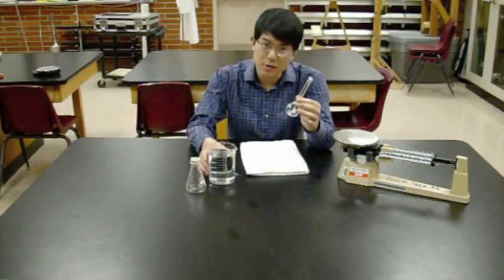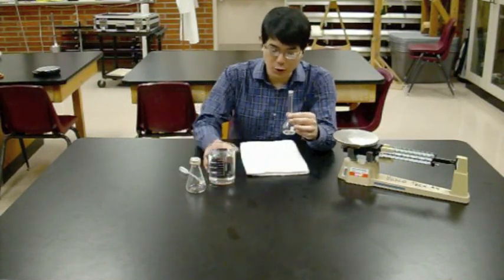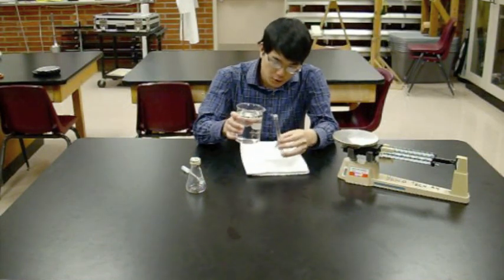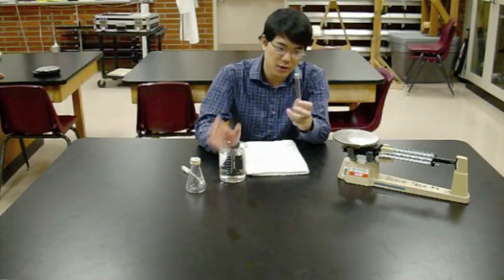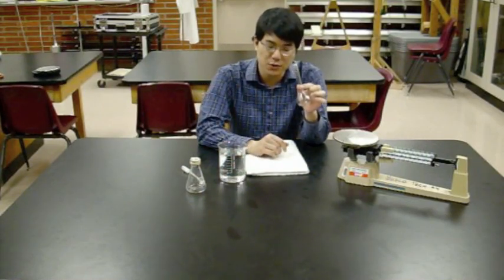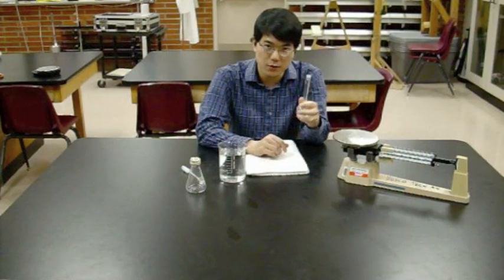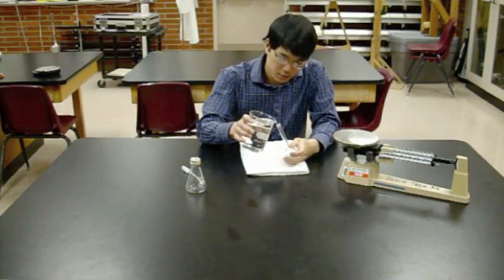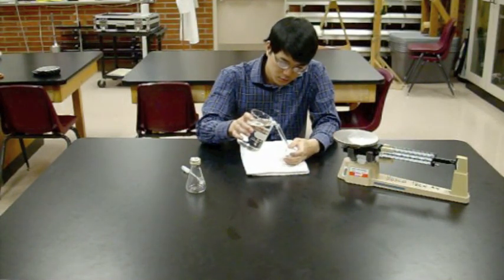Knowing that this is one of the most accurate volume measuring devices you'll find in a laboratory, fill this up to the fill line. When you hold it, hold it from the base, because if you hold it from the neck, there's a chance that your fingers will obscure the fill line.